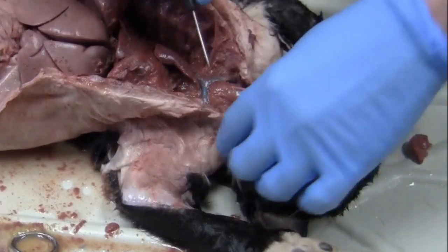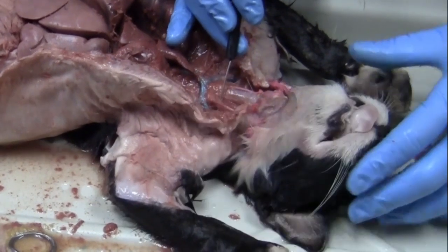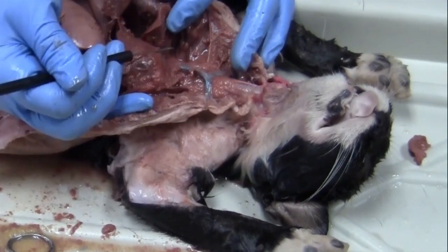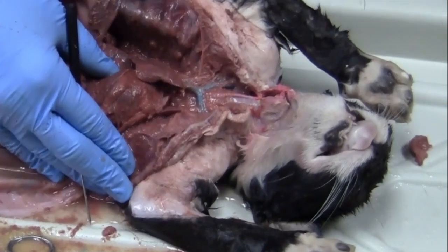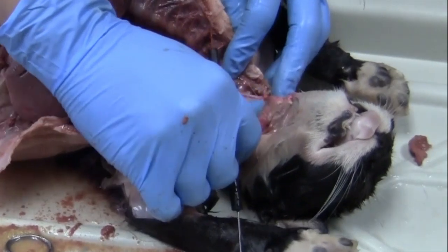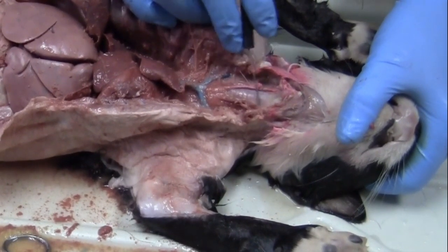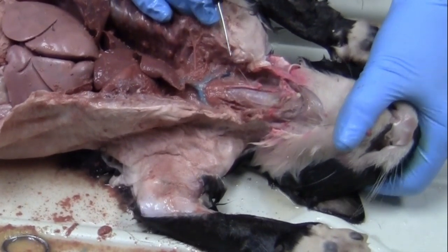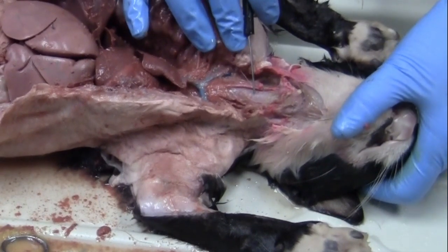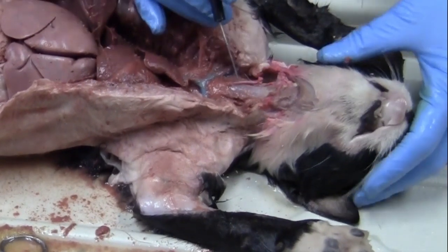So like I said, up here at the top, you can see some bright red and bright blue structures. Move my hand out of the way. So we have this big vein that's right here. That's going to be our cranial vena cava. So vena cava meaning vein. That's this big one that's right here. So on top of that, we can see this ring-like structure up here. This is our trachea. And I shouldn't say they're ring-like, but they're more like C-shaped. So the trachea is what's bringing air into our lungs. So it has to have a pretty rigid structure so that it's able to go against that negative pressure and stay. If the rings weren't there, basically it would just collapse.